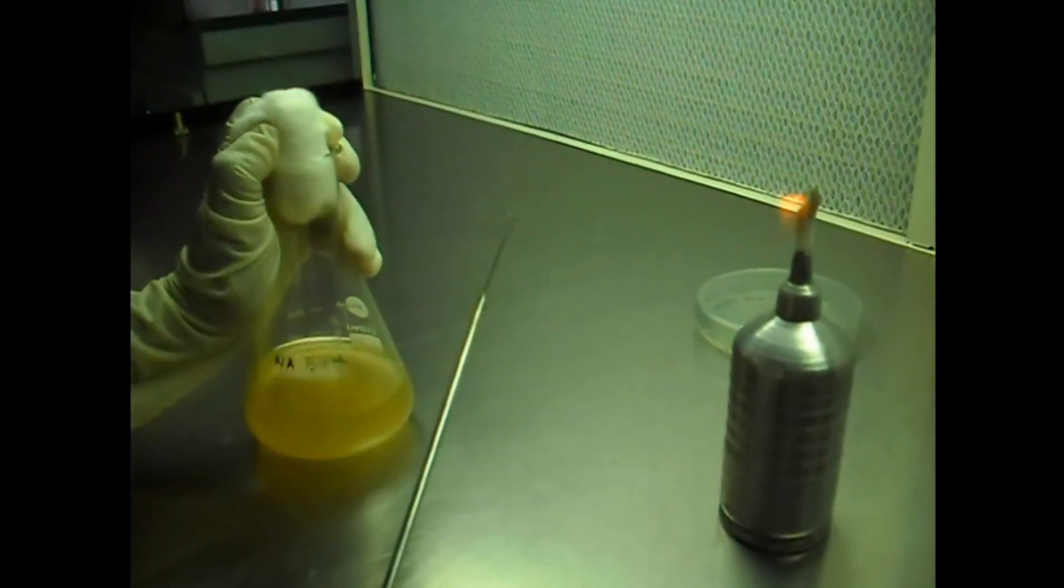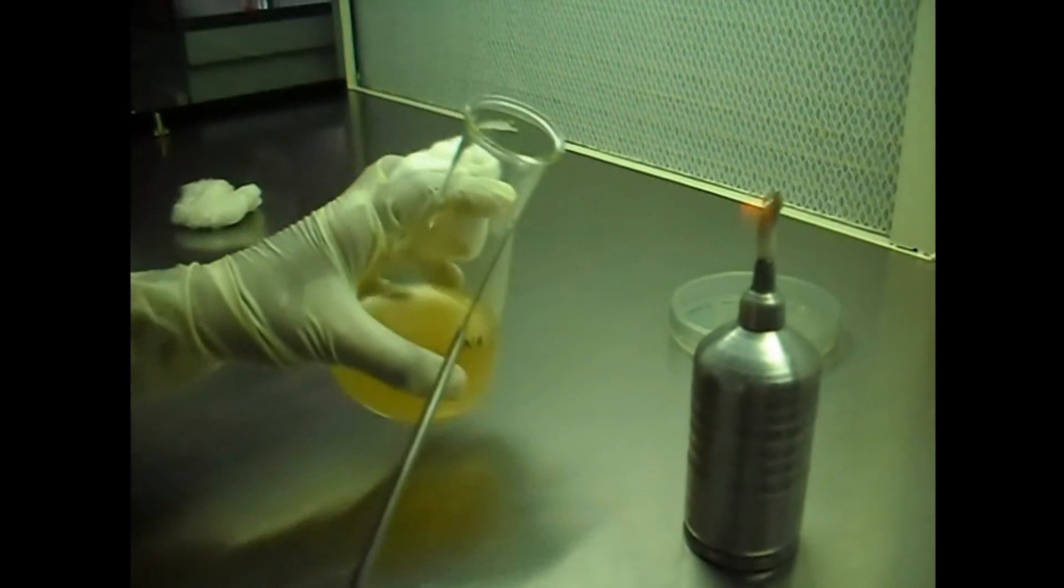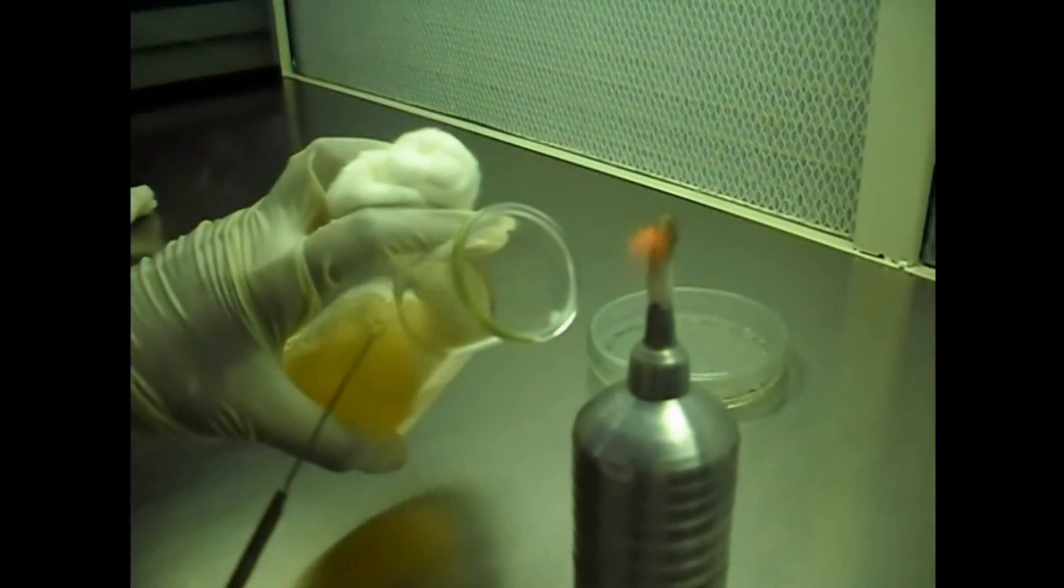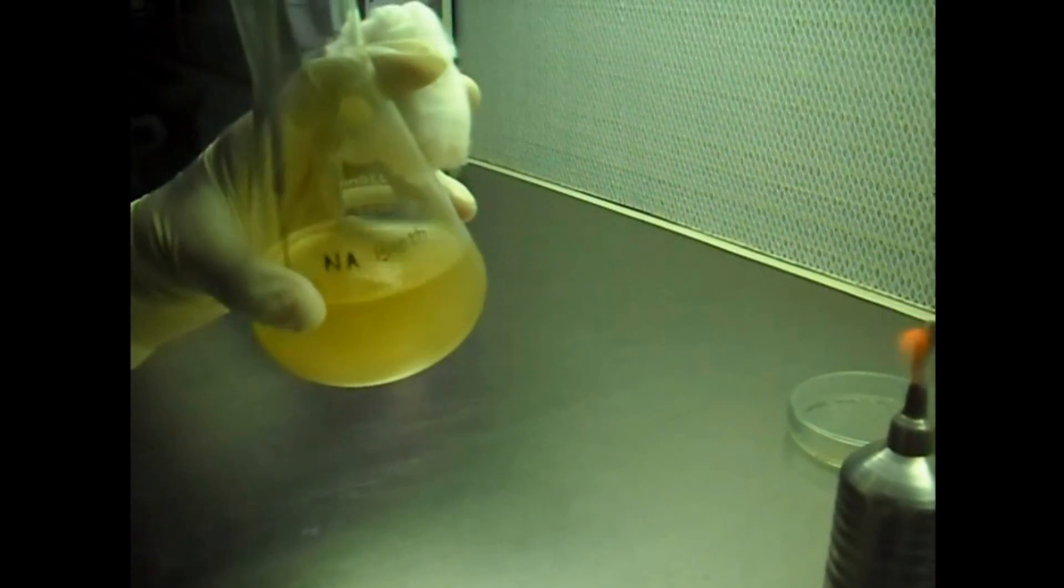Open the broth, show it in the flame, and inoculate the bacterial culture in the broth.